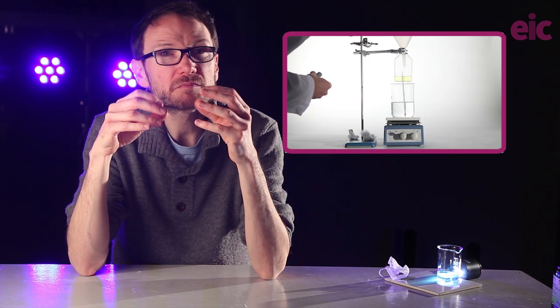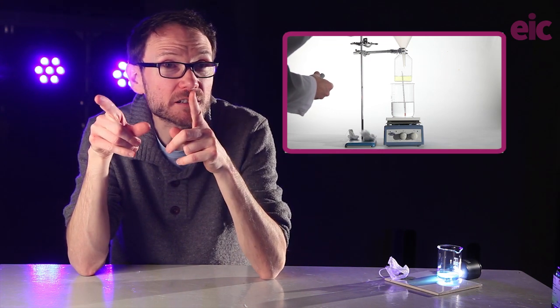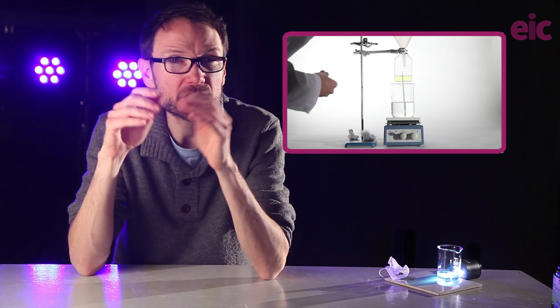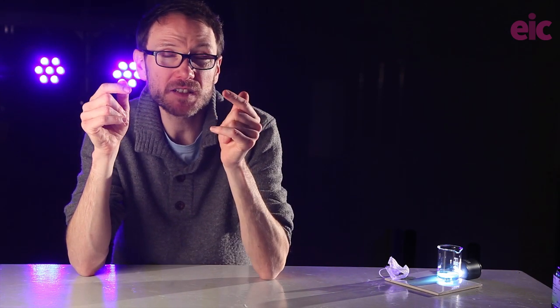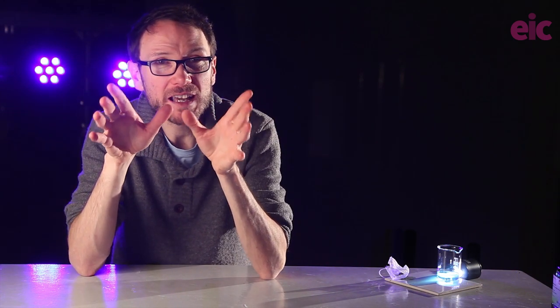In goes some 0.05 molar solution of ammonium metavanadate 5 dissolved in 100 cm cubed of 2 molar hydrochloric acid. You don't have to use the whole lot. Here I think I used about 30-40 ml. Don't forget the safety protocols from earlier when you're handling the toxic powder to produce your solution. Once the solution is made, eye protection is fine.